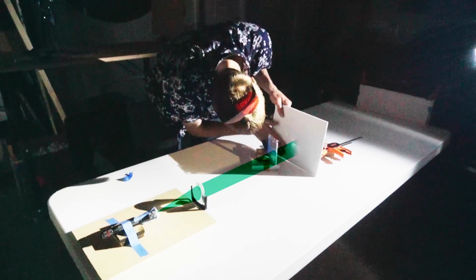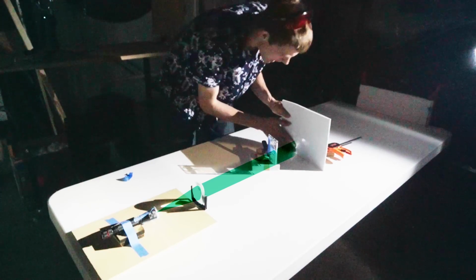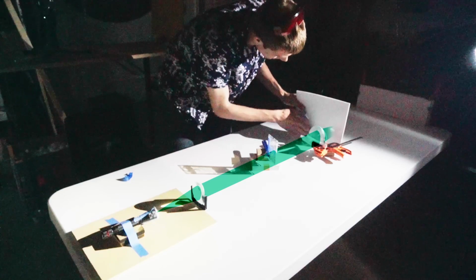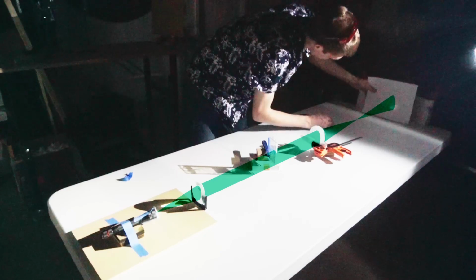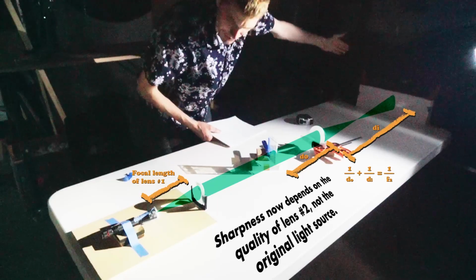And then we can take that beam and, if everything is lined up just right, blow it up to project a larger shadow on the screen. Once we send it through here, it gets smaller, comes down to a point, and then blows up and expands out here. So we have a magnified image on the screen. Remarkably sharp. Much better than I thought I'd get with this.